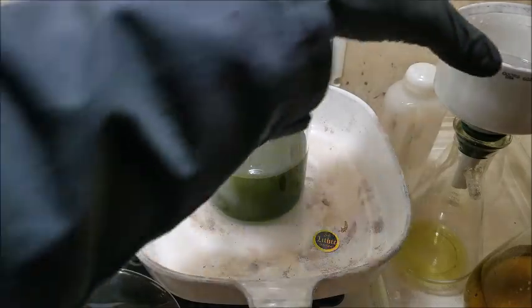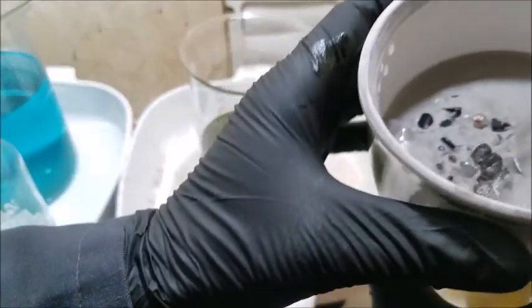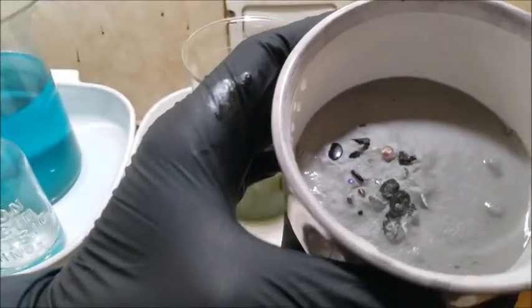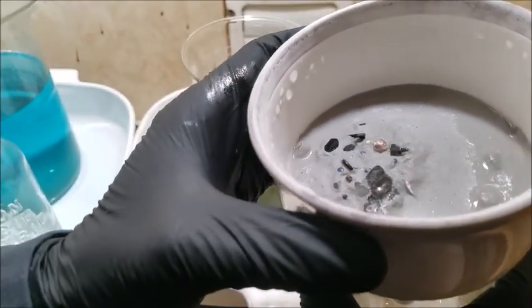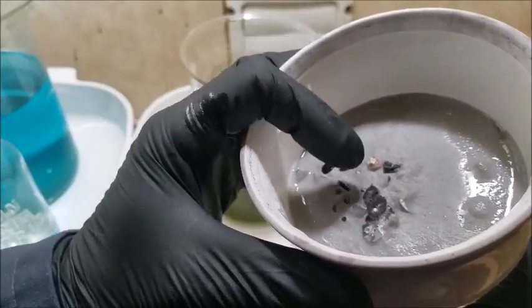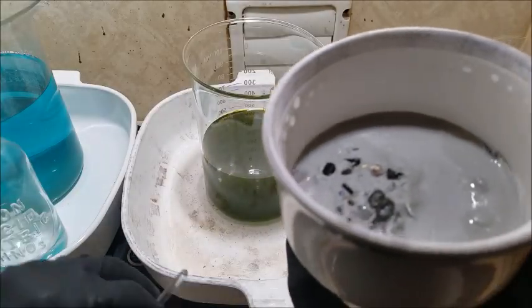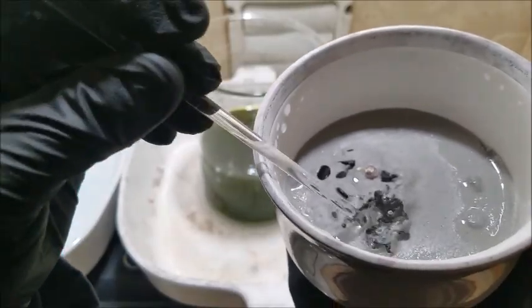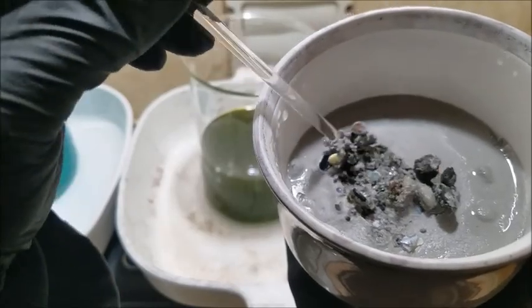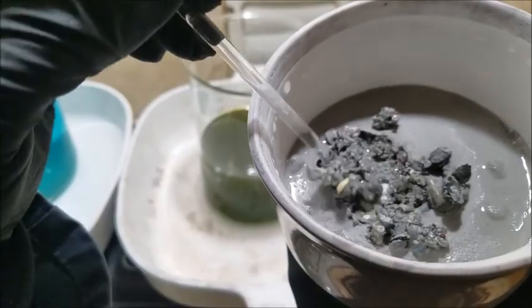Alright, well, here we have it. I'm gonna take a closer look here. Iron mixed with paper pulp. Maybe some silver chlorides, little jewels and such. Various stones. I'm gonna let this dry out and I'll just kind of fish through it a little bit.